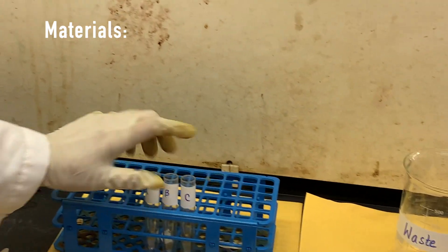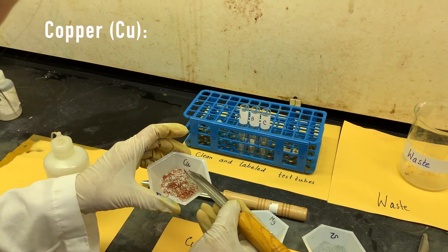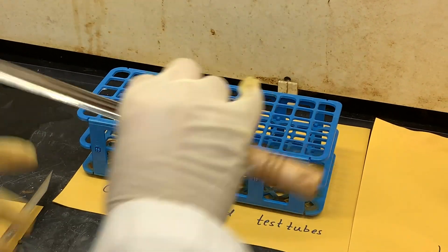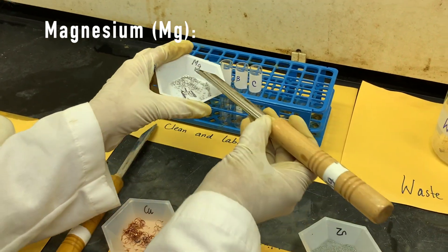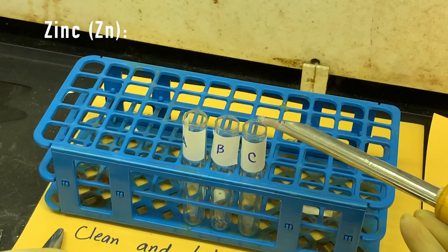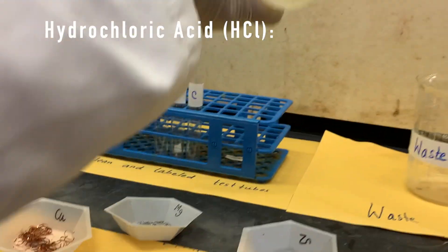I already labeled these three test tubes A, B, and C. Now I'm going to take little pieces of copper turnings into A, a bit of magnesium into B, a pinch of zinc into C. Now I'm going to add 10 to 15 drops of hydrochloric acid in all the test tubes.